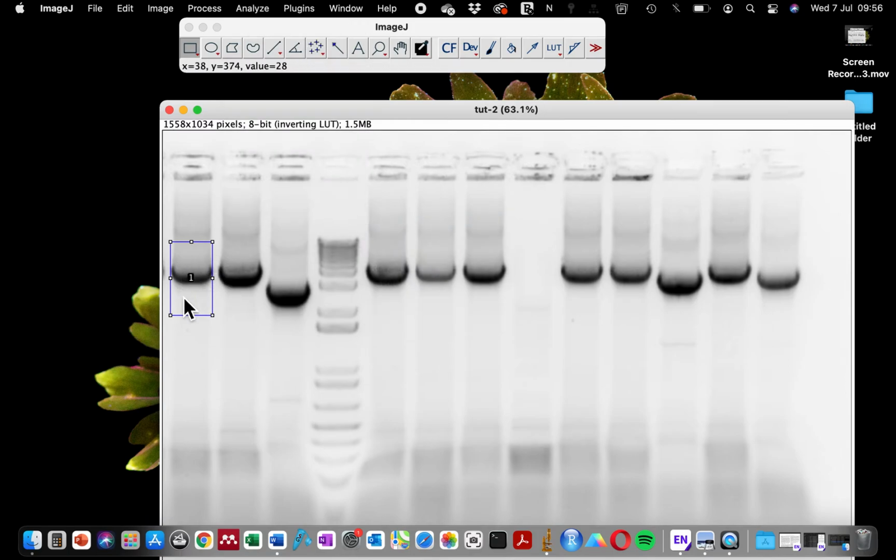After we selected the first lane, if you look closely, you can see that it assigned number one to that band, and that's because we selected this as our first lane. This has duplicated the rectangle tool, so we just drag this to our next band. And if I do this, it seems I have to repeat this because the second band is bigger in size. It's wider than the first one.